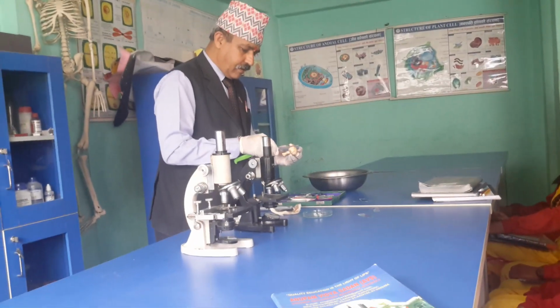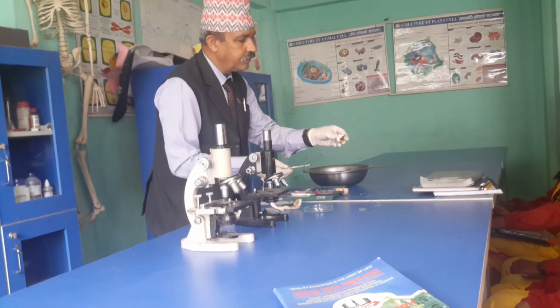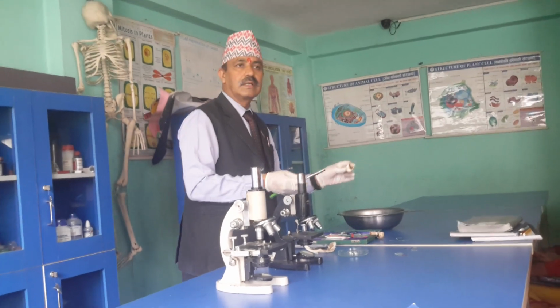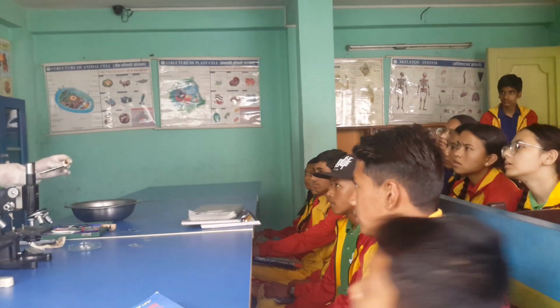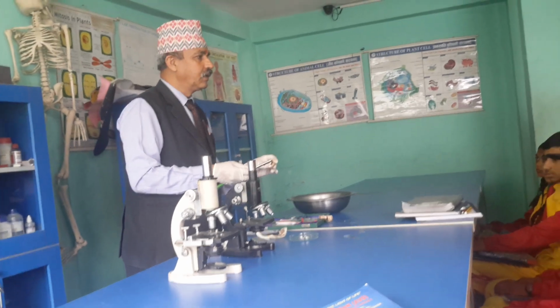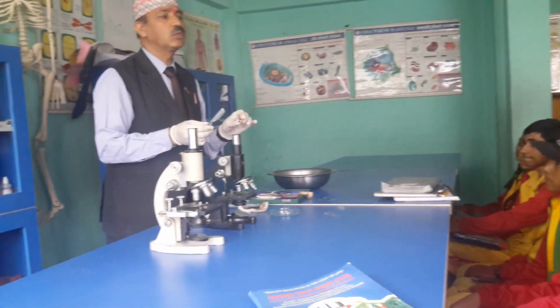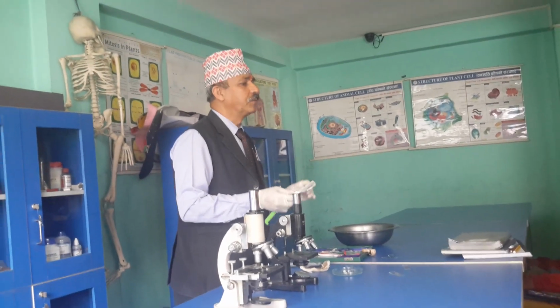Okay, we'll see the gills on this. You can see. Which color is here? Black. Black or brown color means mature gills. What are they? Mature gills. And do you know the three parts of gills? Trama, subhymenium, and hymenium. What are they? Subhymenium and hymenium. So, where are basidiospores produced? In trama, in subhymenium, or in hymenium?